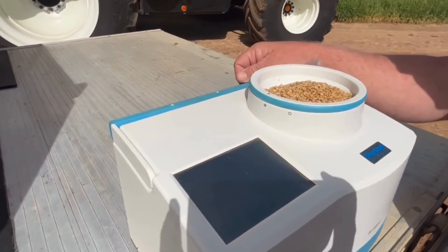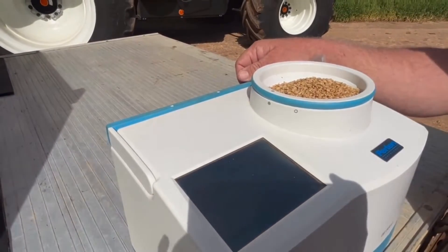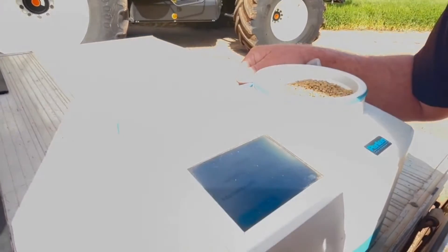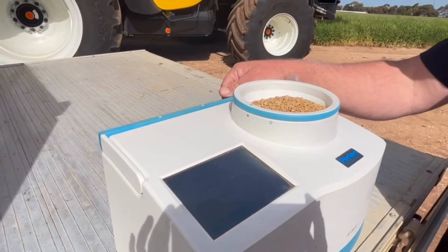The lamp is warming up as we go. I normally start this up first thing in the morning when we're fueling up the header — the hotter the lamp, the more accurate it'll be. Now it's just going to take 10 samples.